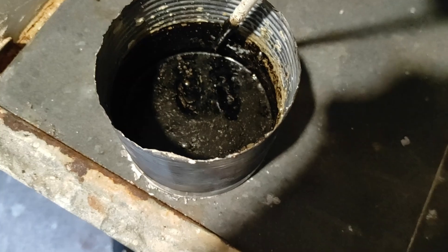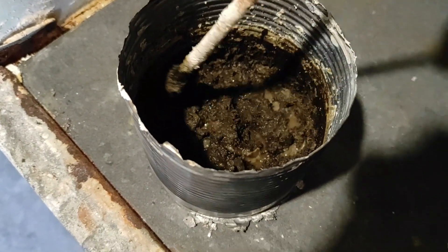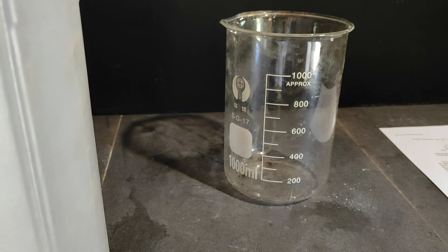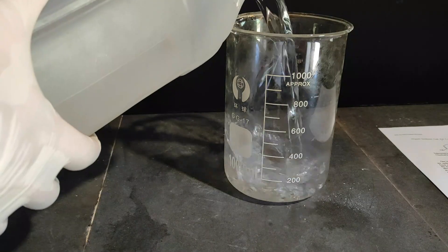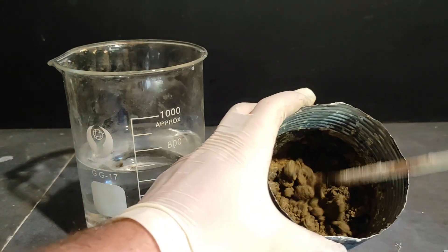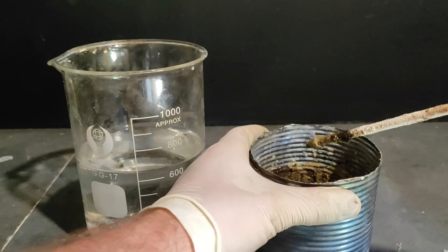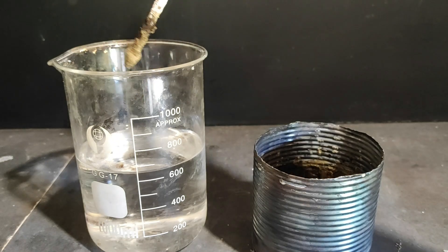So now I took it off the heat to cool down and solidify. I also recommend you actively stir when it's cooling down, otherwise you will form a solid block, which is much more annoying to deal with. We're going to measure approximately 650ml — between 600 and 700 is fine. Here we have the finely solidified product; as you can see it's kind of yellow-brown, a little bit of a weird color. It's still kind of hot, so I'm not going to handle it for too long. And now I'm going to dissolve it basically in the water.